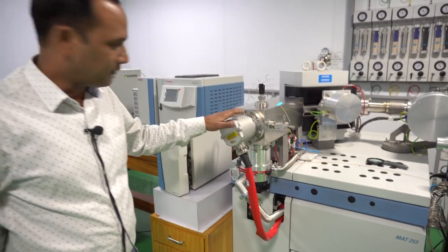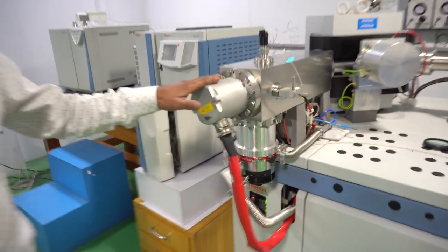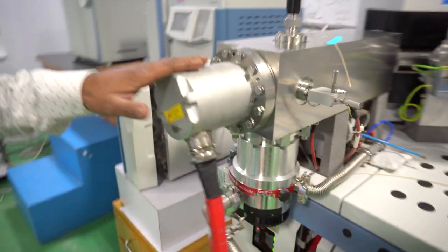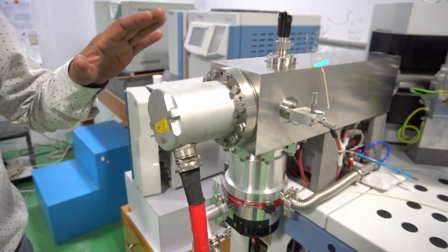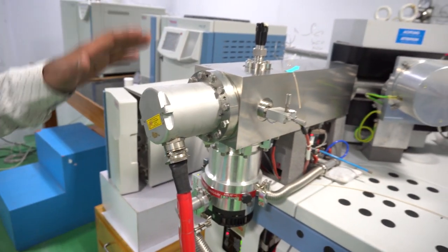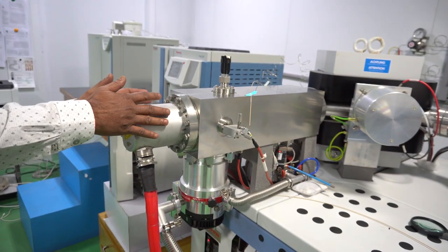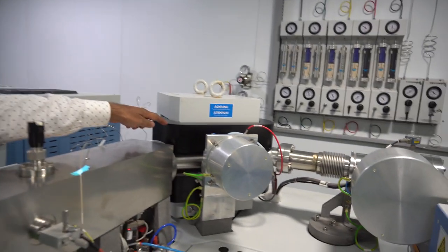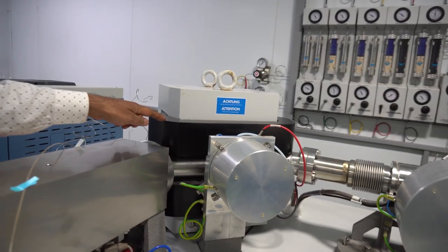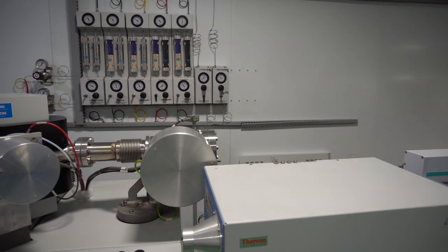This machine is an isotope ratio mass spectrometer, model MAT 253. This model has three parts: one is the source, the second one is the magnetic field, and the third one is the collector.